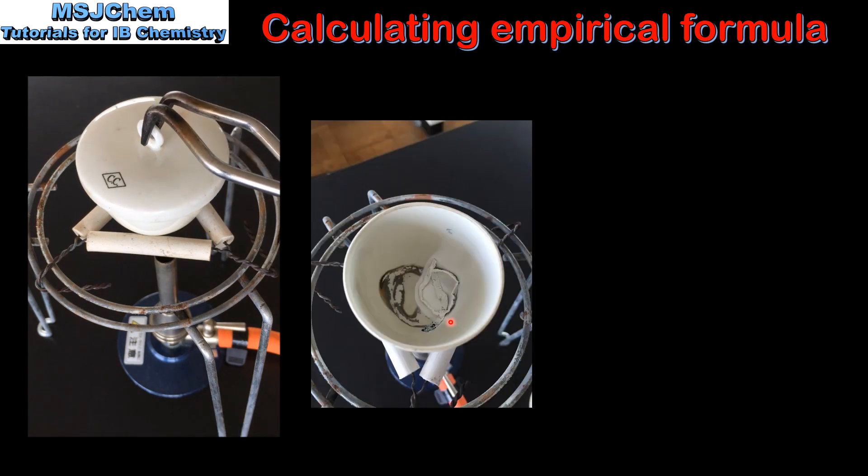Once all the magnesium has reacted, we are left with a white powder, which is magnesium oxide.